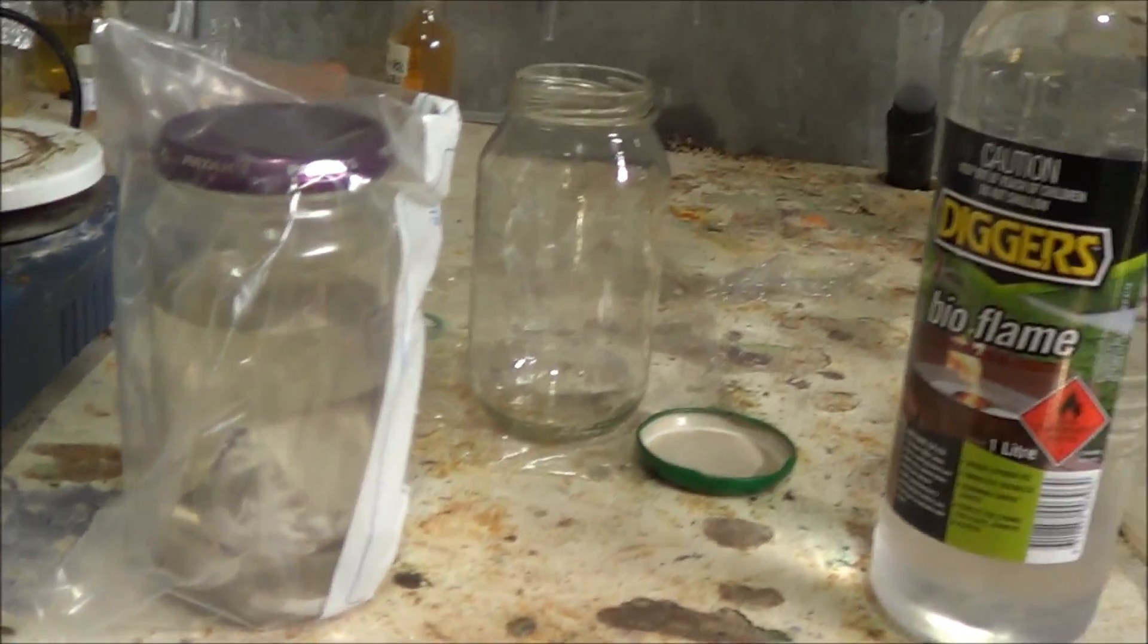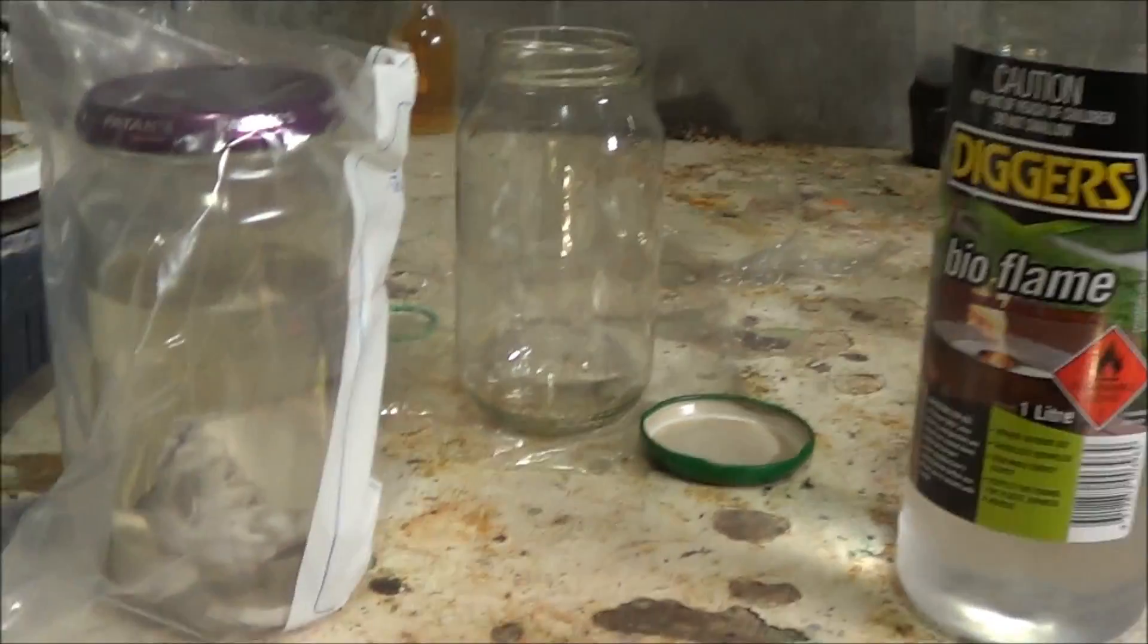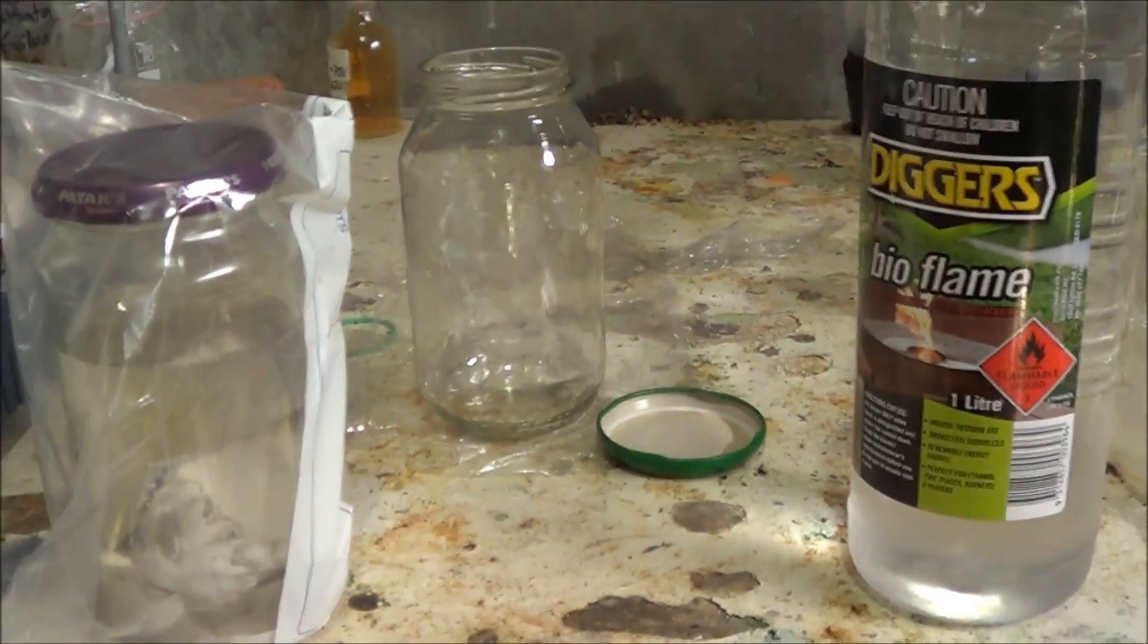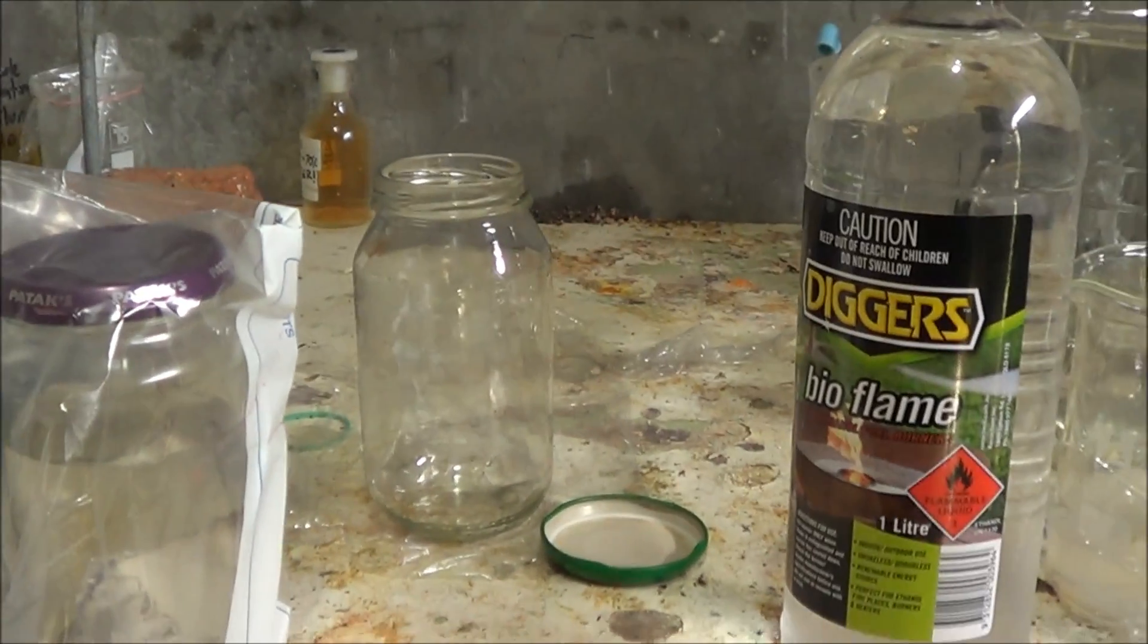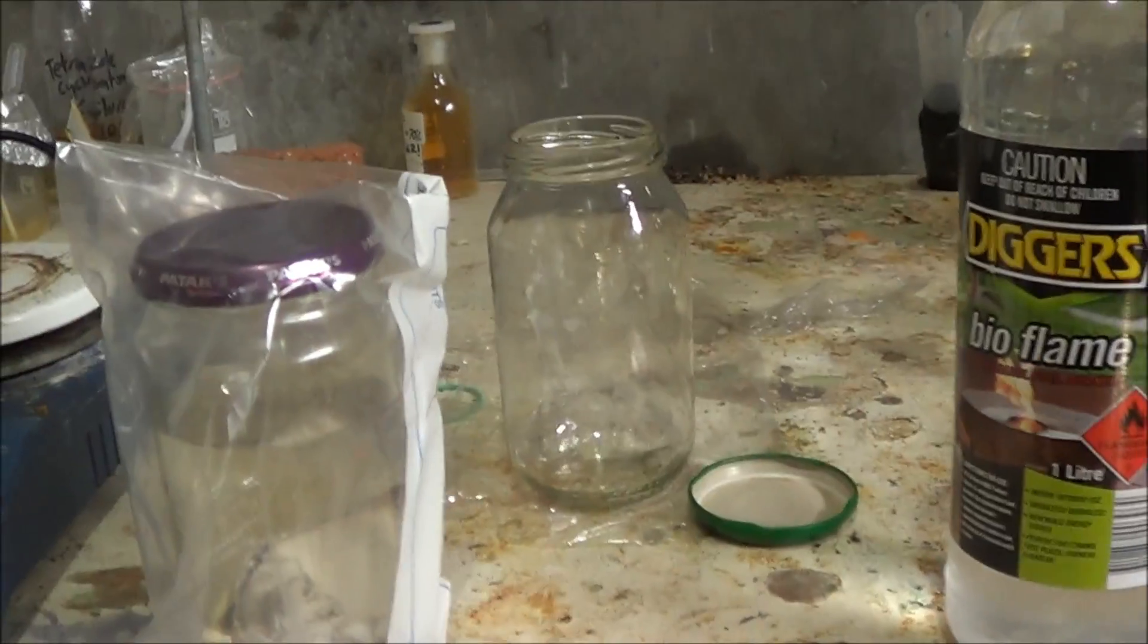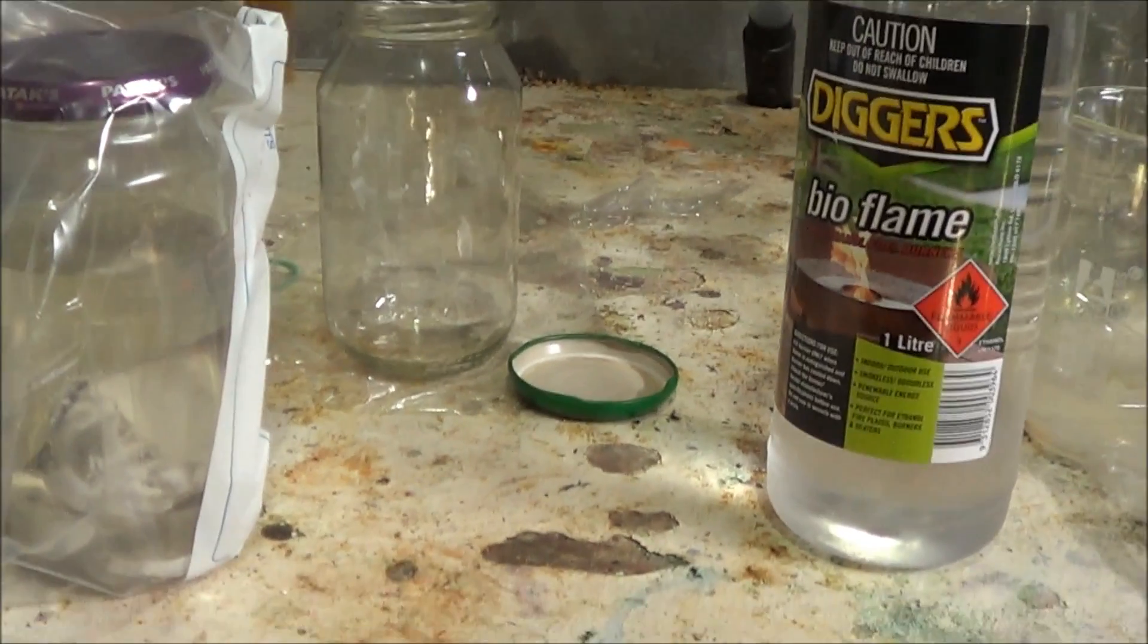Hello again. So today we're making sodium ethoxide from sodium and ethanol, and we're going to be using this later on perhaps to react with nitromethane to try and form some interesting products which may or may not work. Knowing me probably won't work, but I thought this video might be interesting in its isolation anyway.